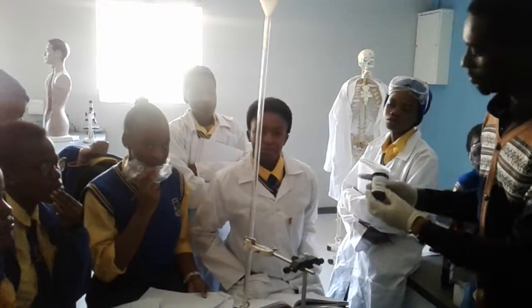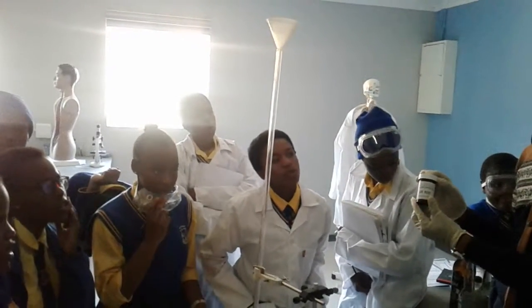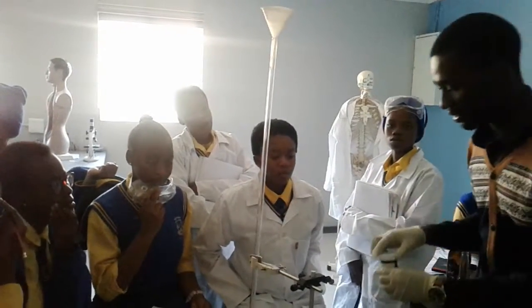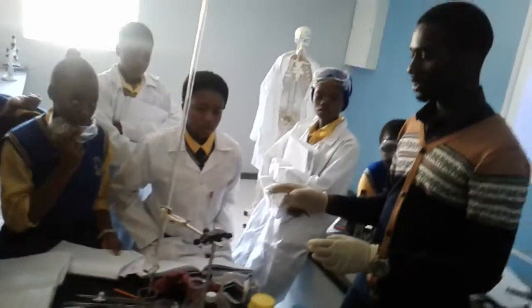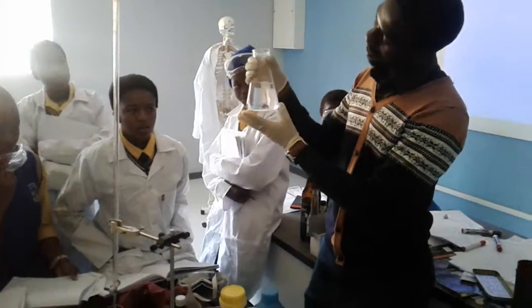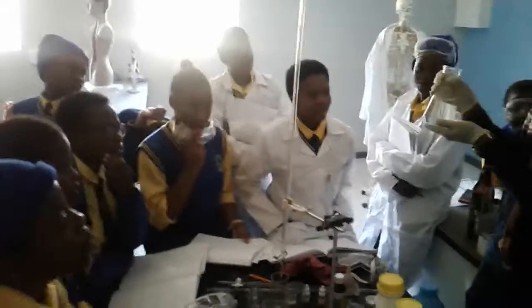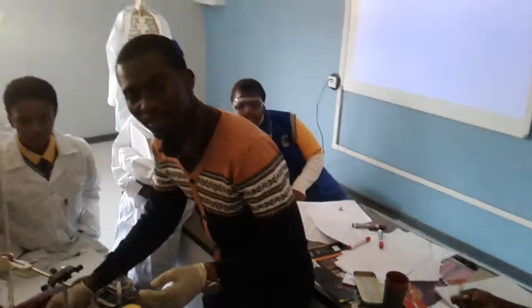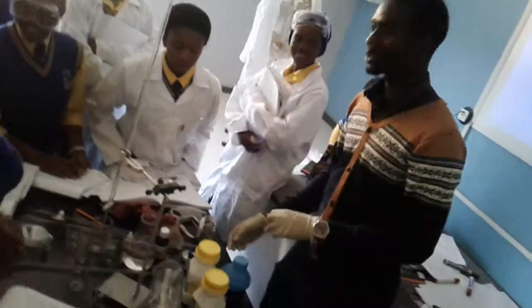Perfect. Oxalic acid, what's the formula of oxalic acid? So this is oxalic acid, and then what we're going to do? We'll start. Okay, what is this? Water. Now, it being water, is it an acid or a base? Alright. So what we're going to do, right?